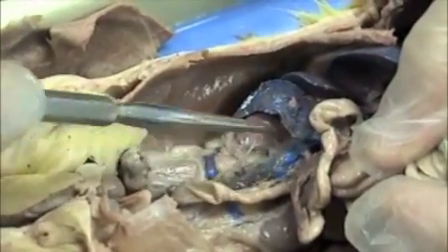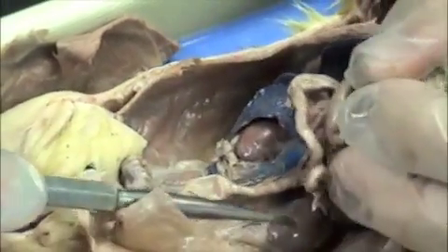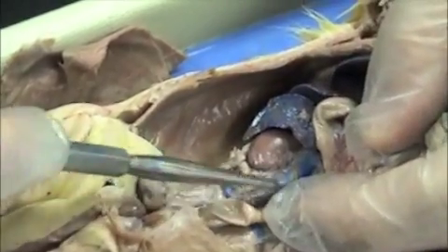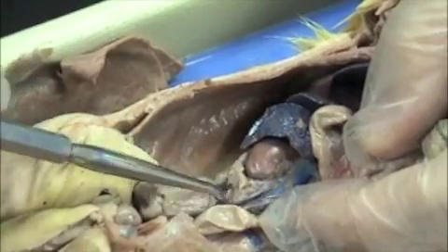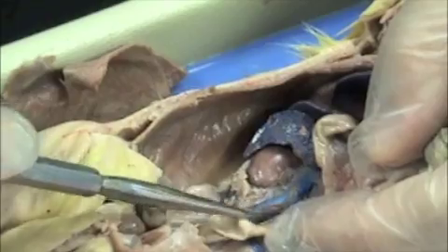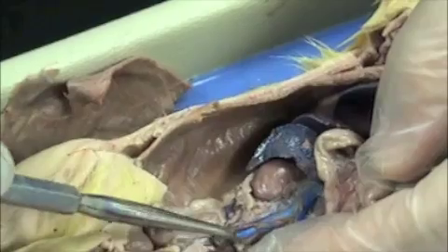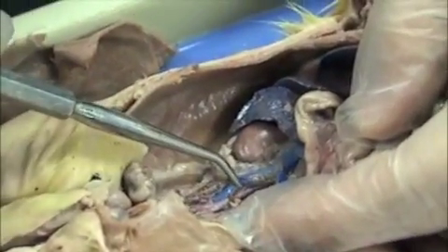Here are some more of your connective tissues. Here is one kidney, and over here is a second kidney. You can see this blue line here coming down — that's the inferior vena cava. We should be able to find the red one right beside it, the abdominal aorta, and there it is right beside it.